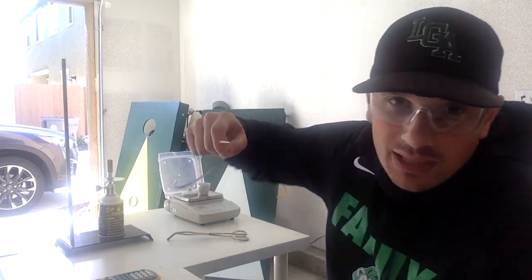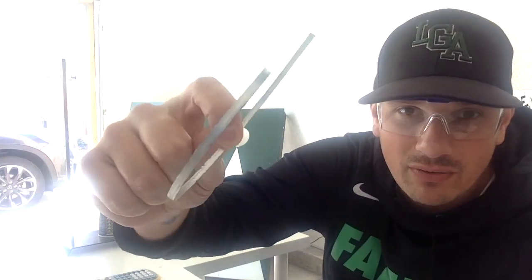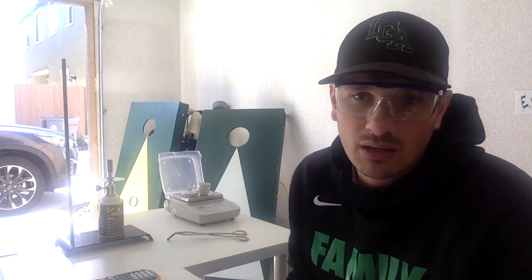And hopefully it's going to turn into magnesium oxide. Magnesium looks like this beautiful little metal right here. It's going to turn into this white ashy powder. Once the magnesium oxidizes, it just kind of disintegrates. It turns really brittle because it makes that ionic compound. You can see a lot of other metals oxidize, like iron rusts, silver tarnishes. So that rust and tarnish is another way we call oxidation.